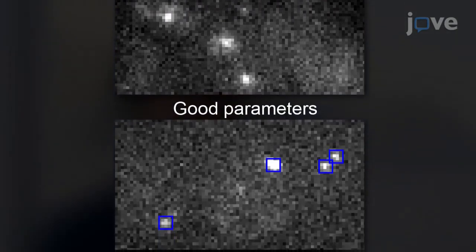Our demonstrated application could become important to gain insights in diseases such as fatty liver disease or type 2 diabetes by resolving lipid droplets and fatty acids below the diffraction limit.